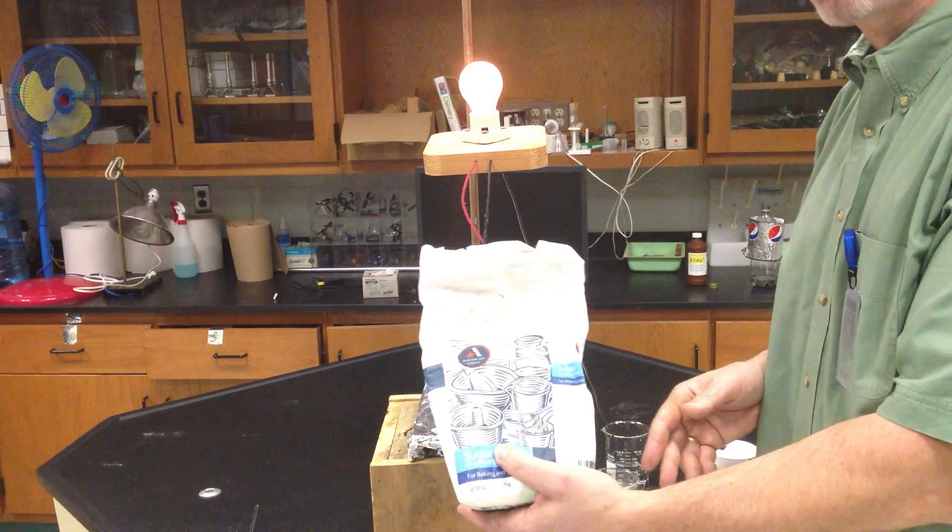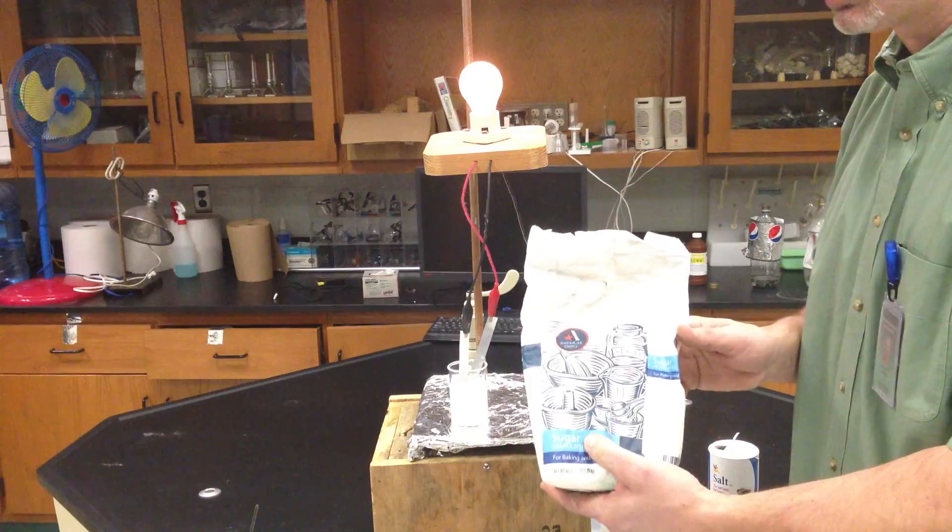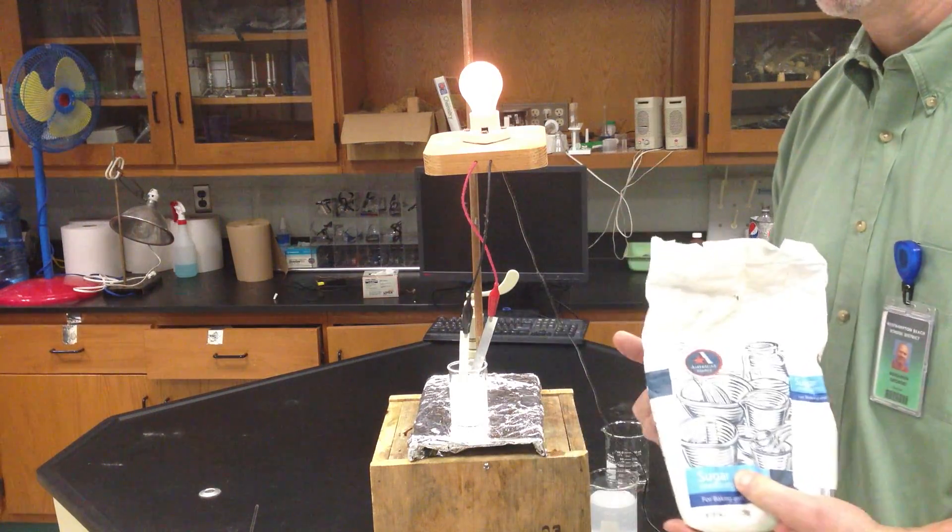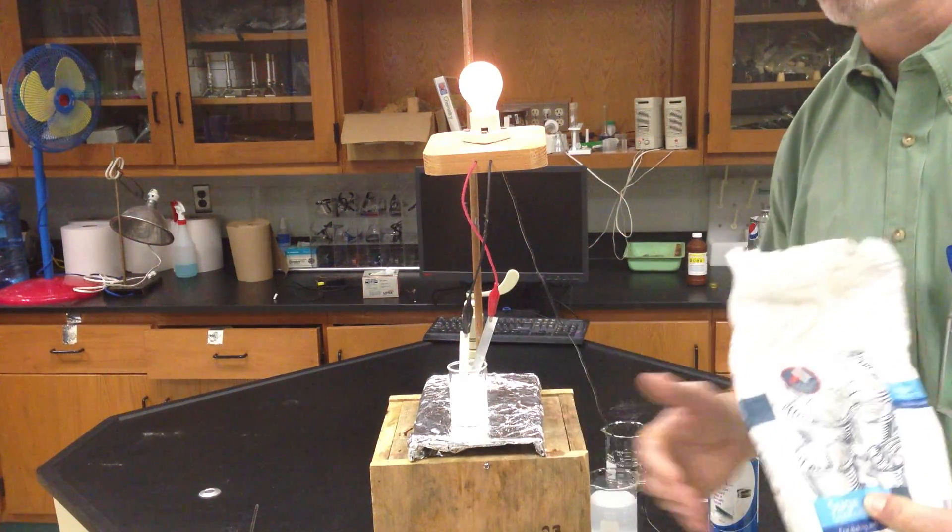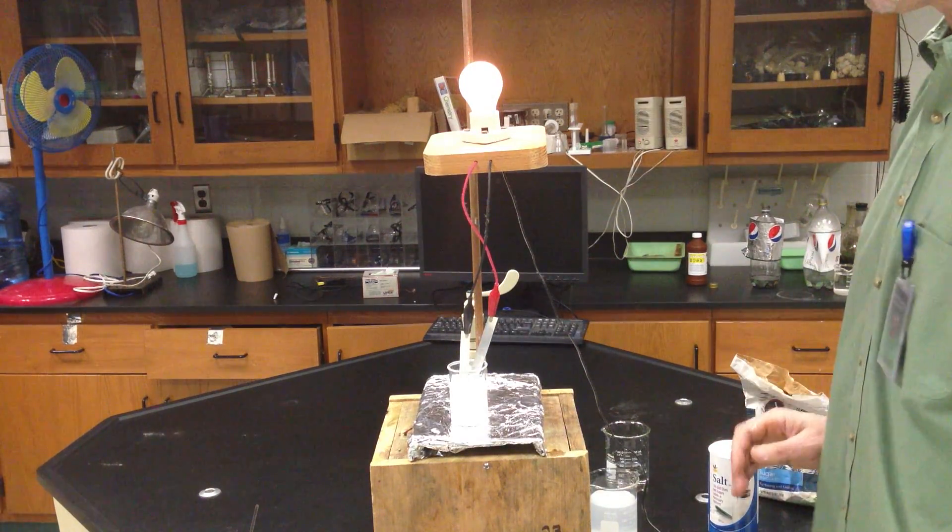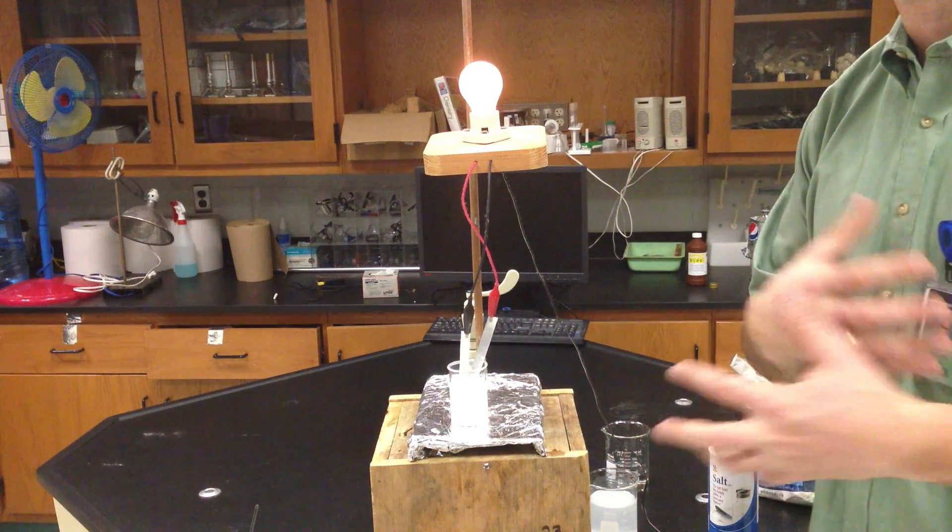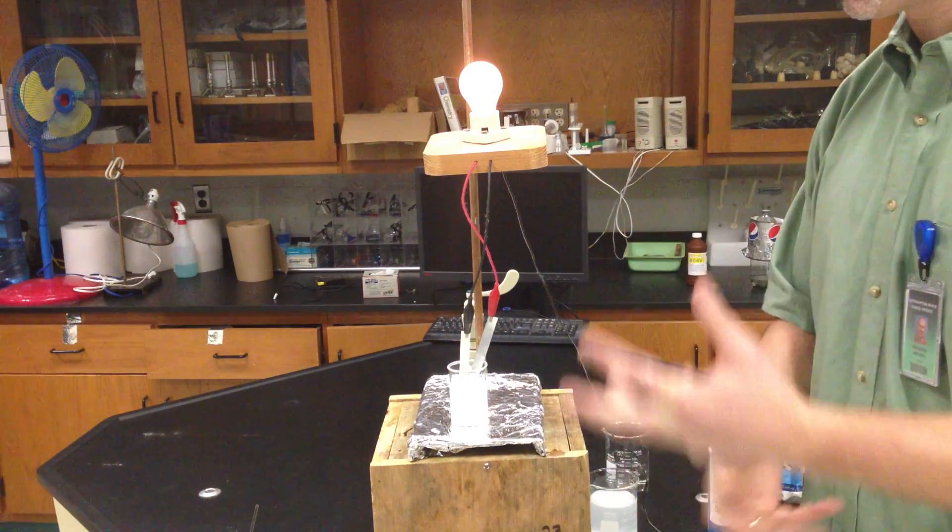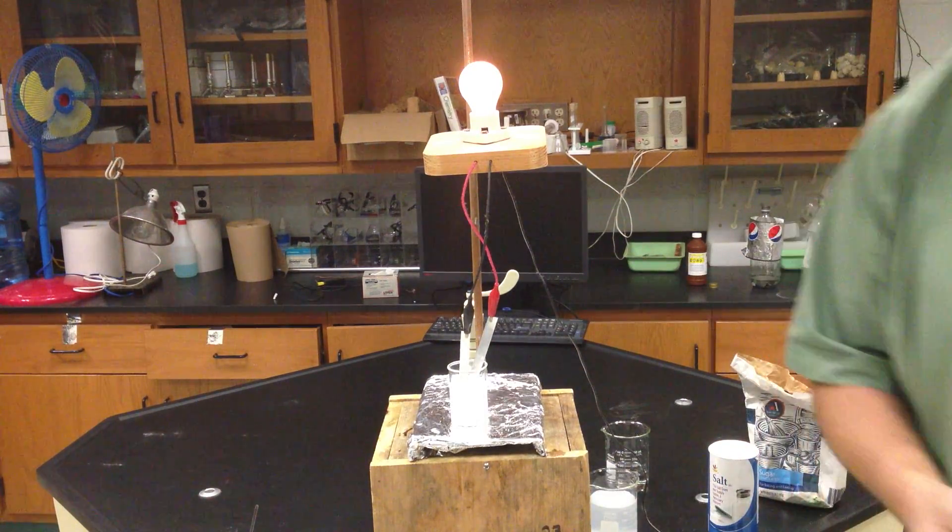Things that are made of sugar or anything that's made of non-metals cannot conduct electricity in solution because they're not made of charges. They don't break apart into ions. So salts, ionic compounds, are electrolytes. Same electrolytes that conduct electricity throughout our body. That's the reason why we have to have some in our bodies.